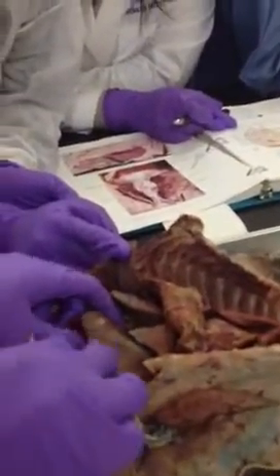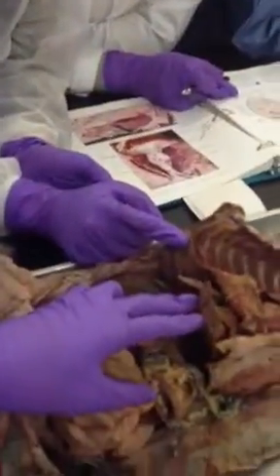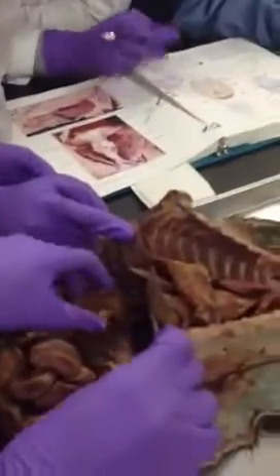No, throw them away. I mean, I can spread this out. So it looks like that picture in there. Are they dirty? I can even take this stuff out if I want to. We have more than enough cats.